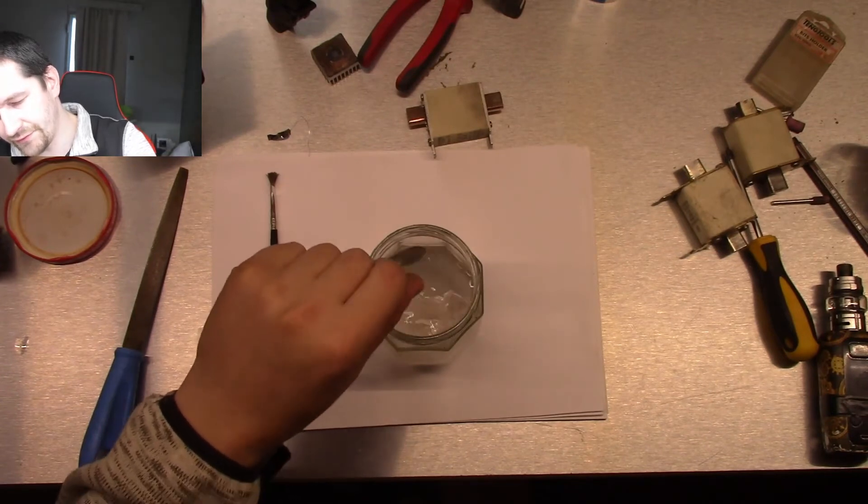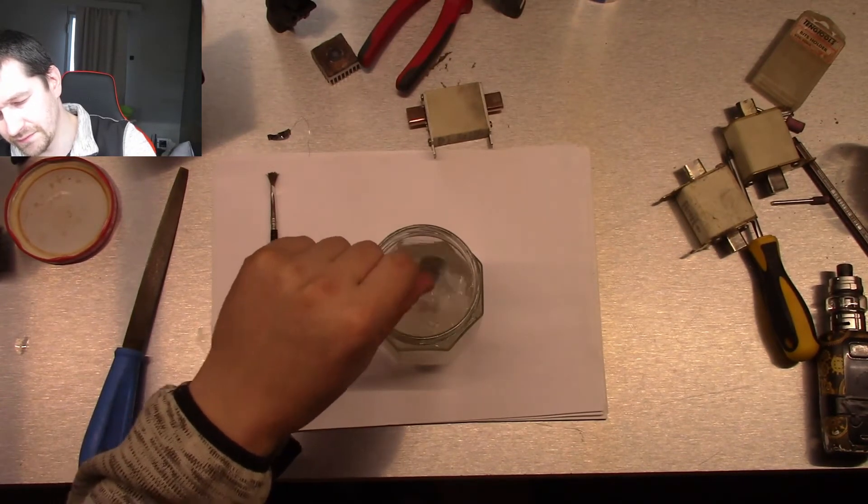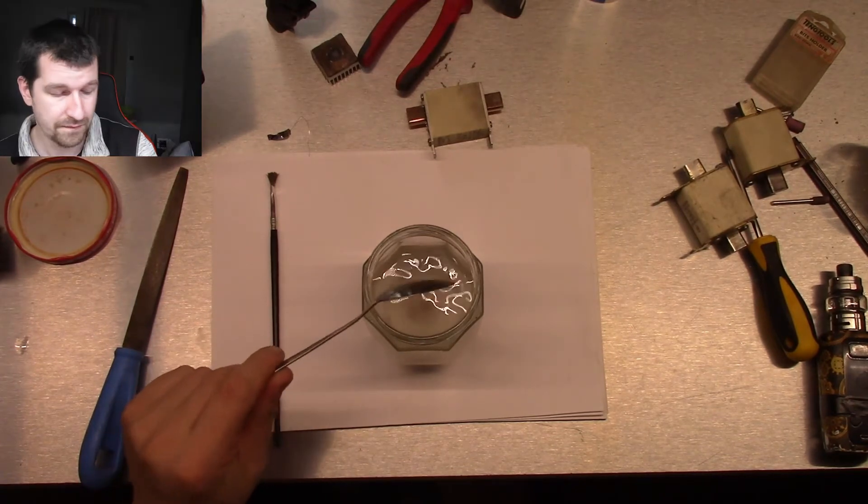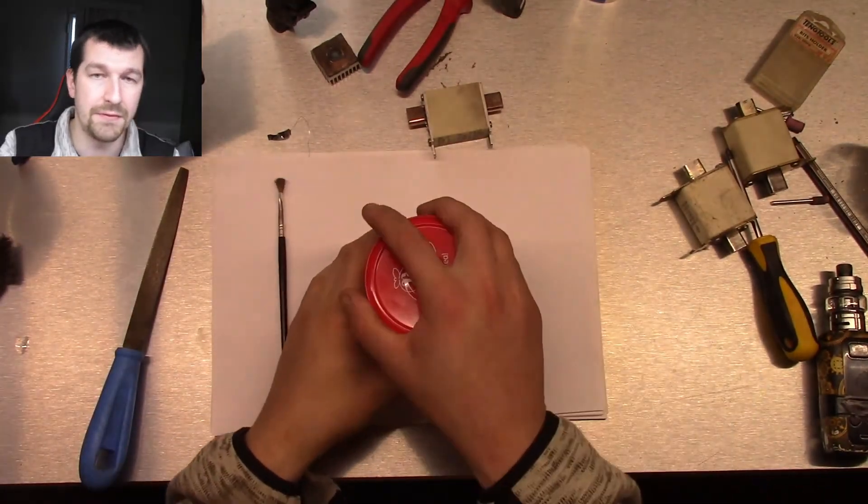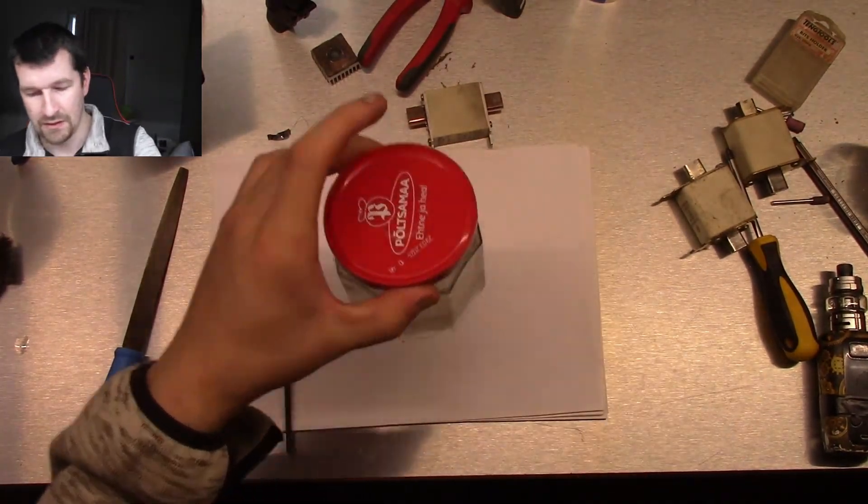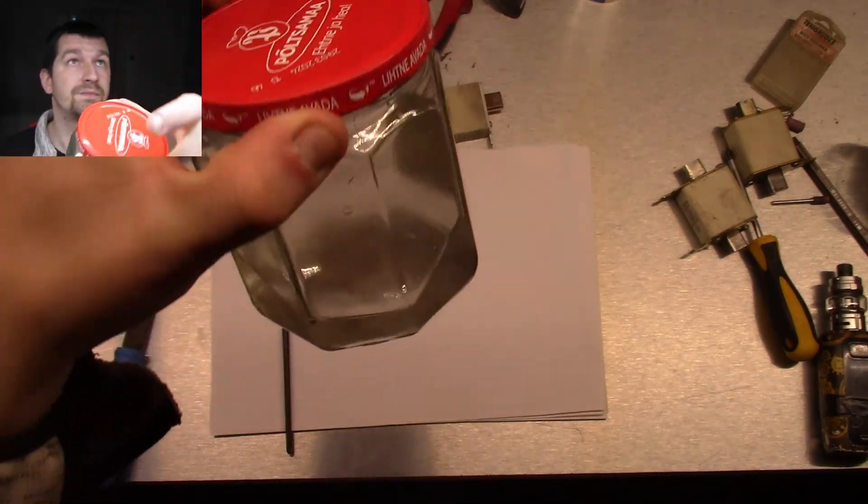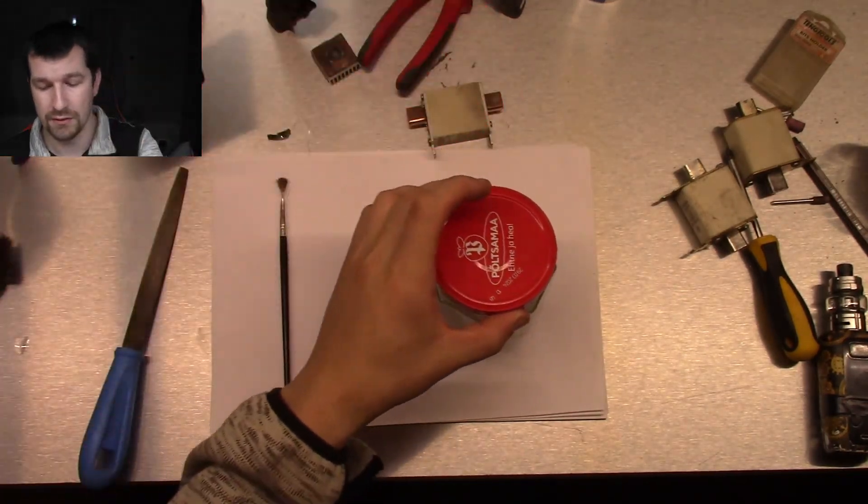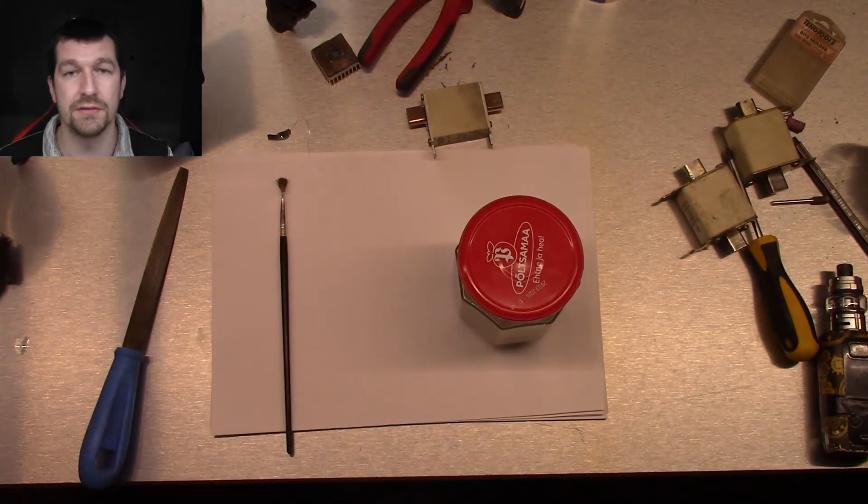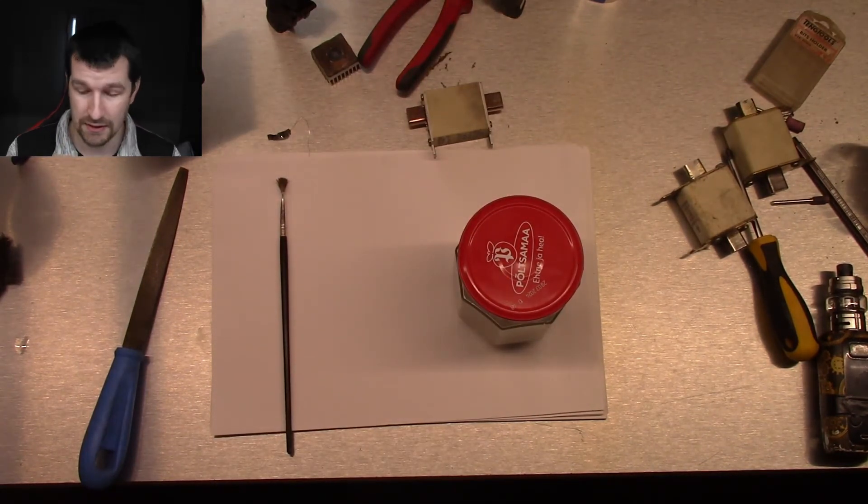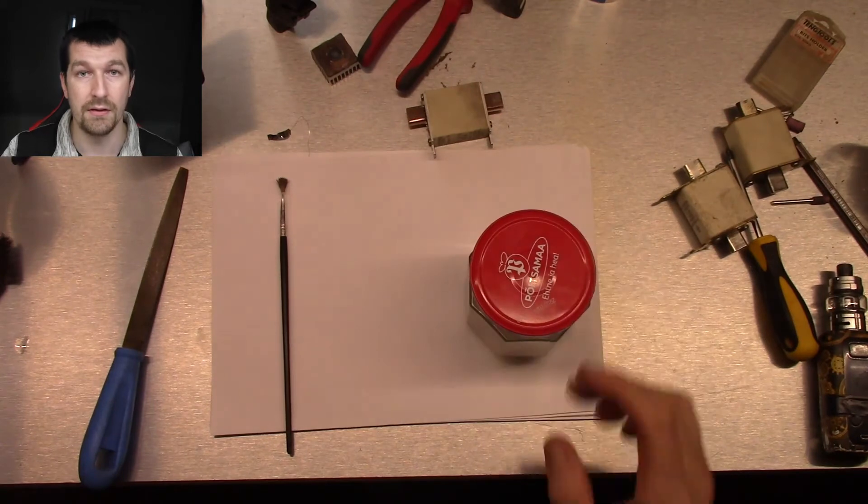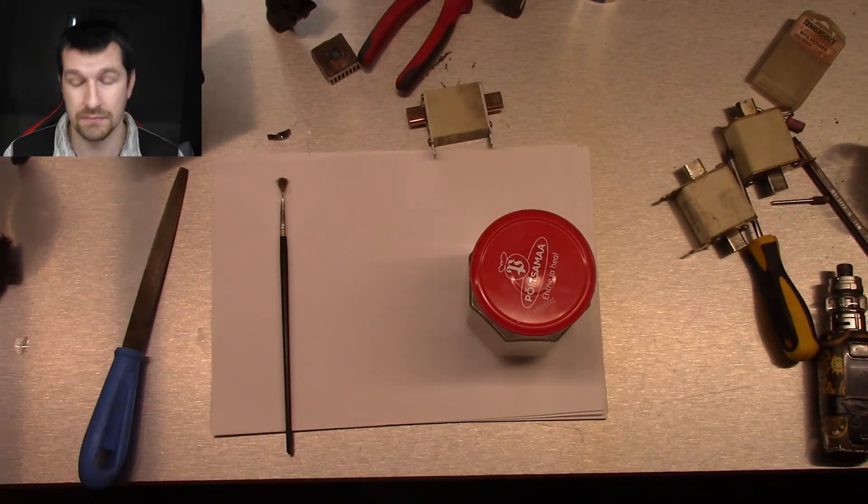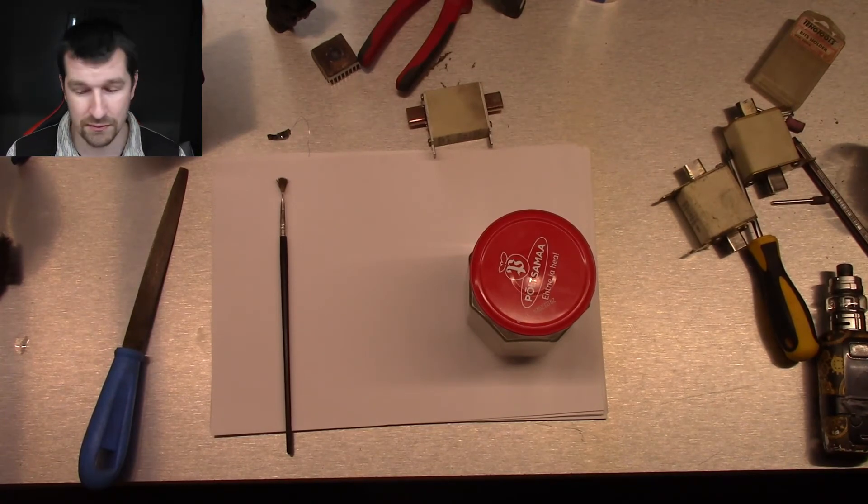There is a really, really tiny amount, but it's, I believe, enough. If something happens, that liquid should turn greenish, bluish, or something like that. If we are lucky, we are ending up with pure silver. At least that's what I'm thinking and hoping. What's going to happen.